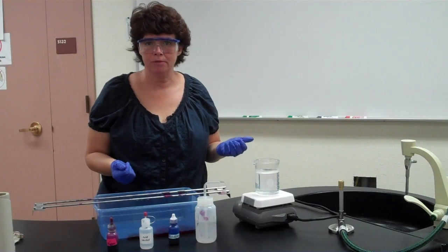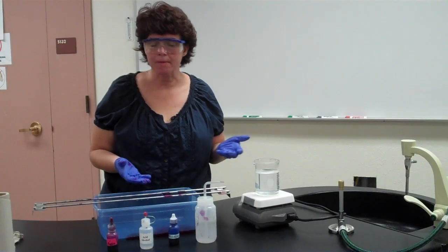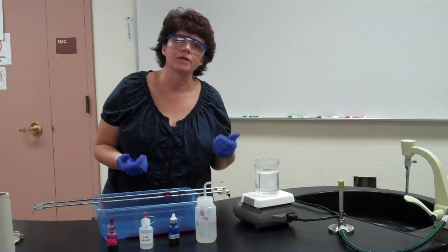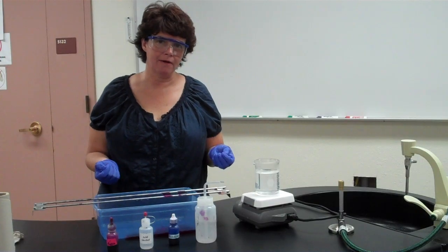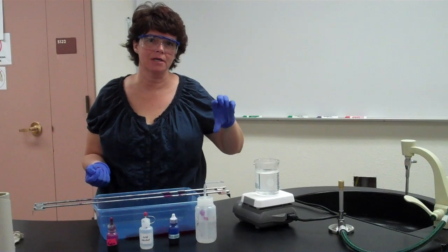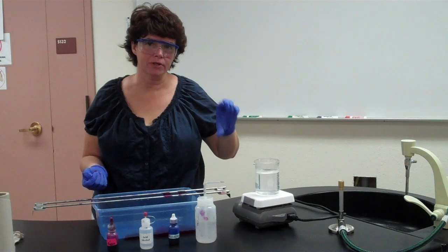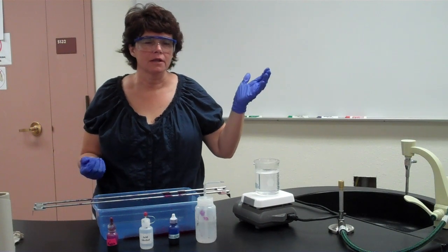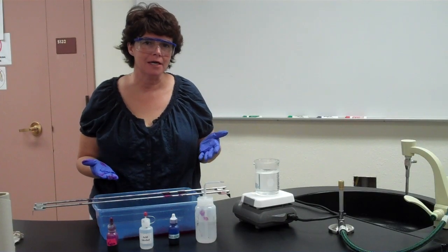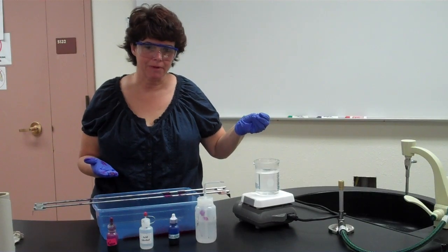Not all Mycobacterium are pathogenic. We are using a non-pathogenic Mycobacterium called smegmatis. When you label them, make sure once again that you label on the back and you label clearly and you know what you're writing down. The stock tube is labeled and the writing on it is sometimes interpreted differently. Make sure you have the correct bacteria and that you label it correctly. You don't write a letter of a word that's not a bacteria that you're using. So make sure you know ahead of time what bacteria you're using and the bacteria that you're taking off the cart is the correct bacteria.